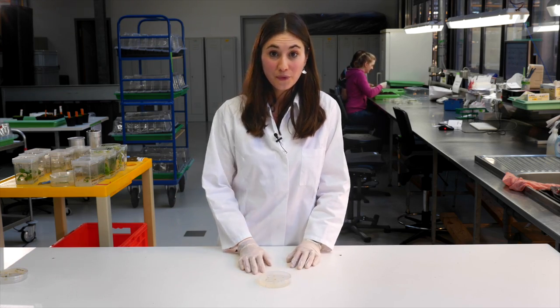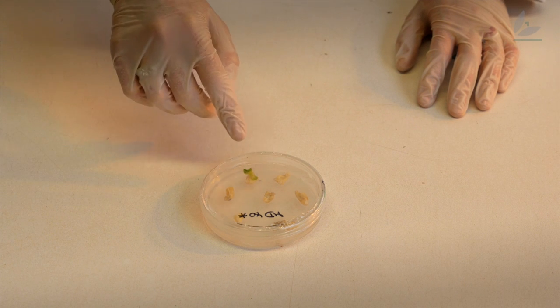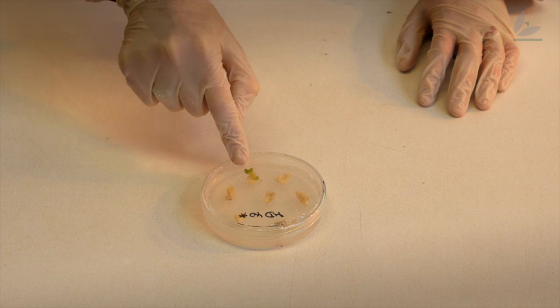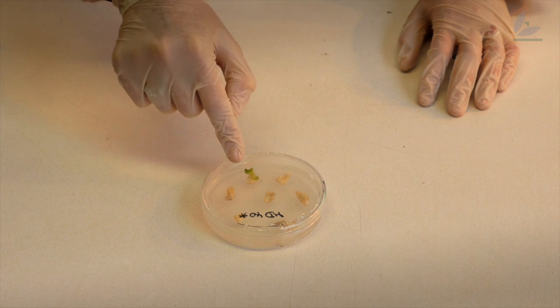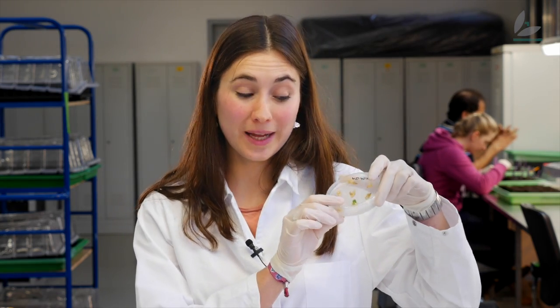I let this grow for three weeks. Here I have a three-week-old plate and you can see that from all seven pieces, only one of them has a growing plant. This plant has the antibiotic resistance gene, which means that the transformation has worked here and this plant contains my gene as well. The cool thing about plants is that from this single small plant you can generate many more plants, and that's what I've done in this box.